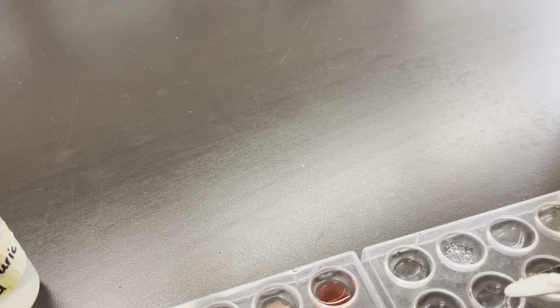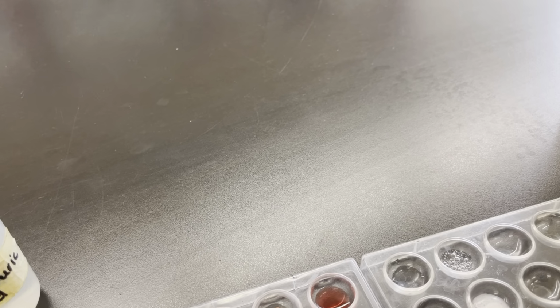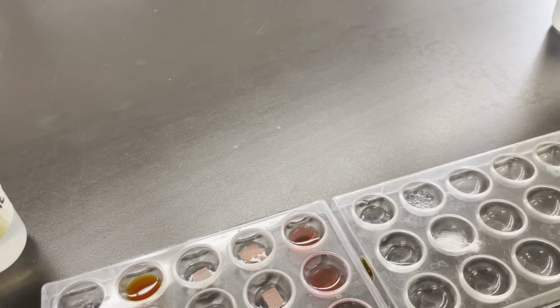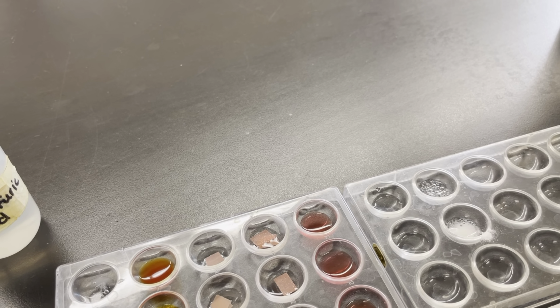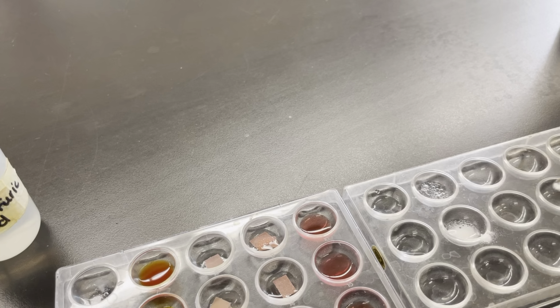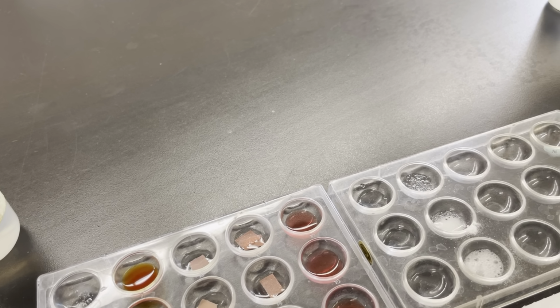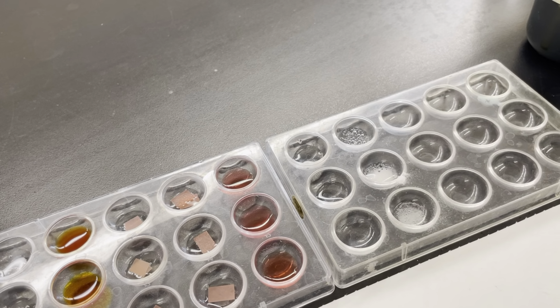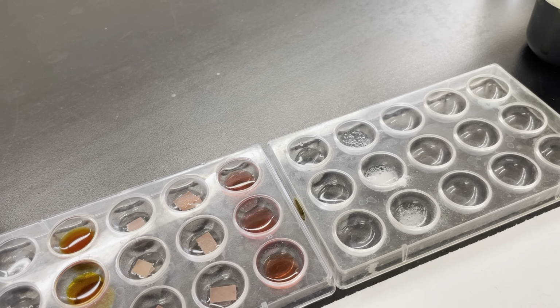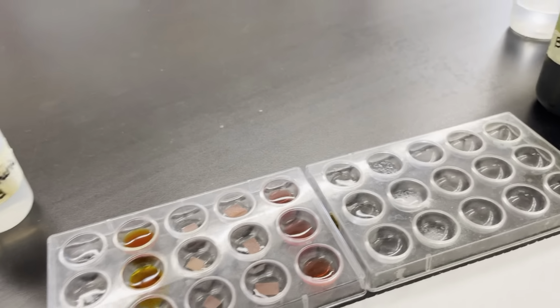Now it's all reacted, so you can still see the bubbles that are left over. Oops, I definitely put more into the second one. It's bubbling. We may not see it all disappear just because I put way too much in that one. And our bottom one, the acetic acid, that one also had the proper amount in, and we can see it bubble really quickly and then go away.